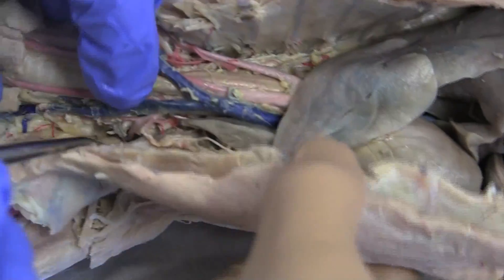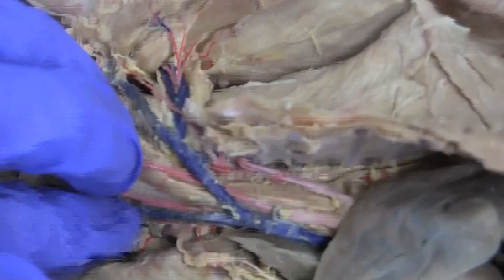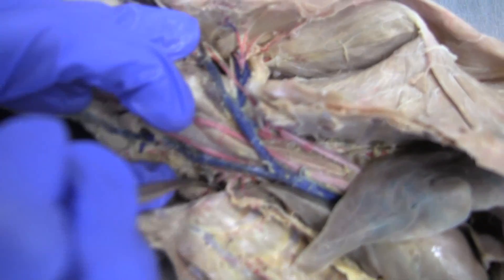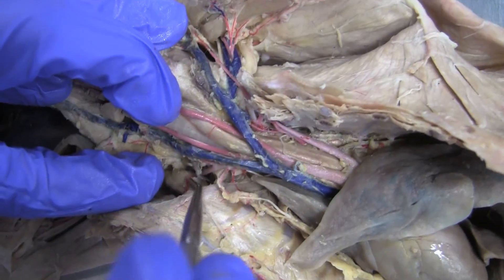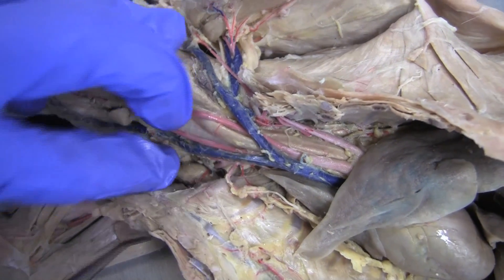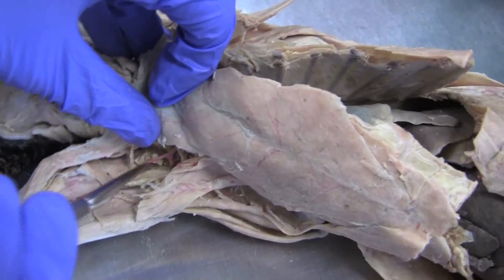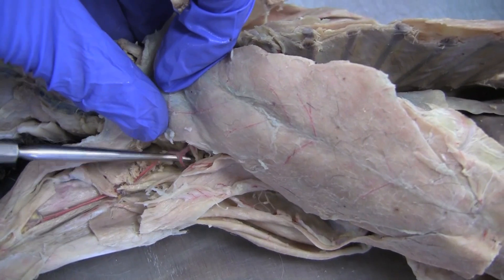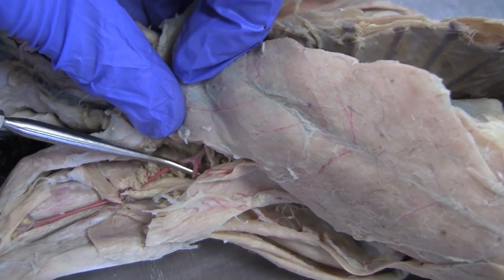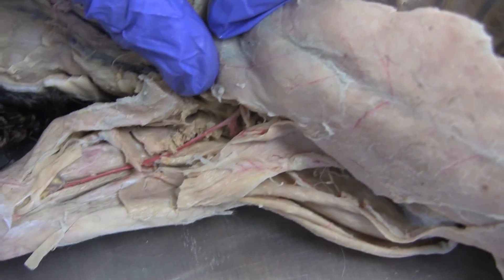On our cat, it has — off of that — then it's going to have your long and ventral thoracic arteries. But ours branch off, so they're kind of the same; you'll have the ventral and then the long will go down. Then continuing on, you have the subscapular, which is right here, and then the brachial artery going out into the arm.